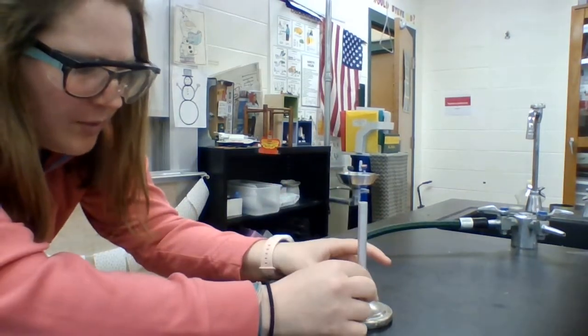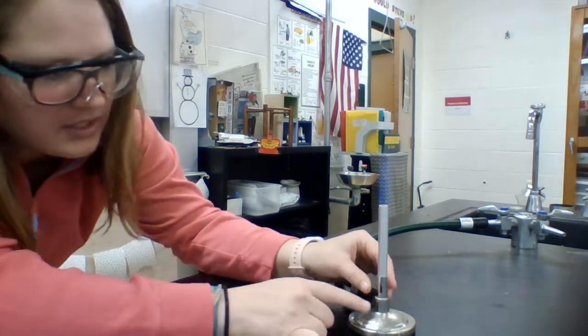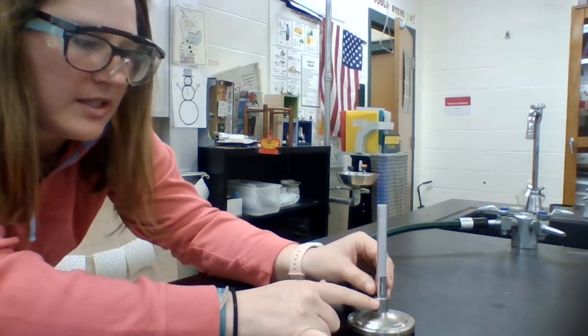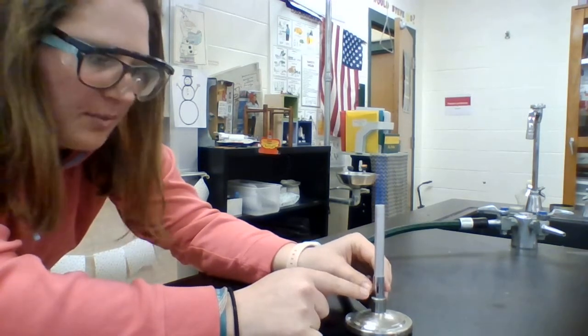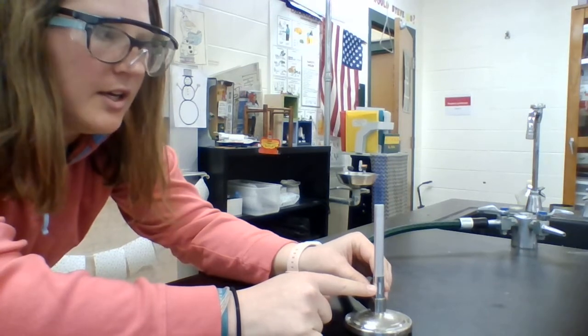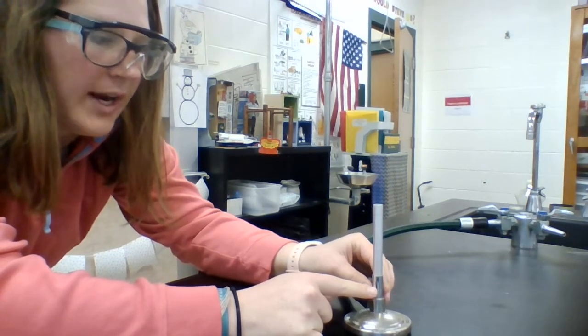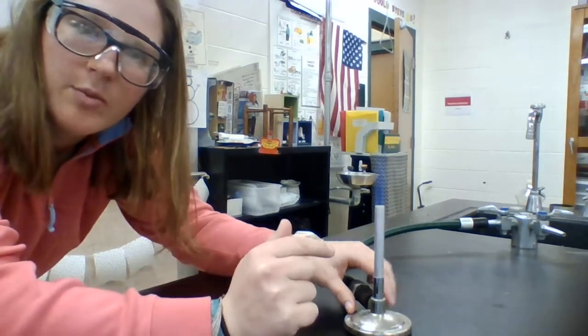What we have down here is a little nozzle. You can see that it has gaps in it. This is what lets different amounts of air into the chamber where the reaction is happening. So this changes how much of a combustion reaction we're getting. We can add different amounts of fuel. The more air, the hotter, the higher the energy. So we actually get a double blue column when we have more.